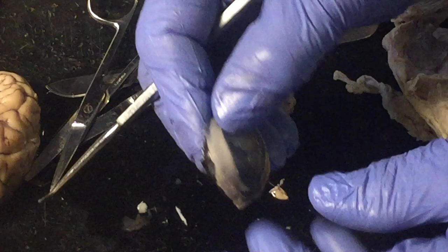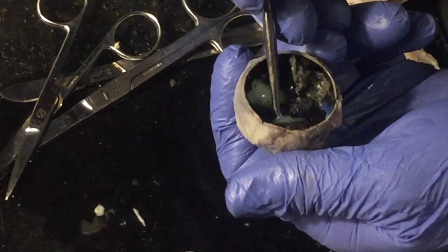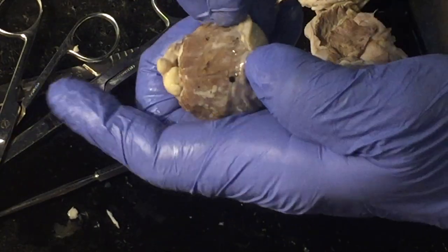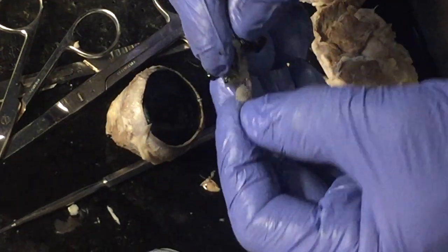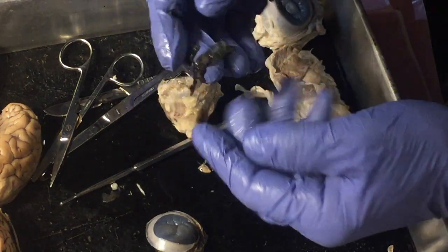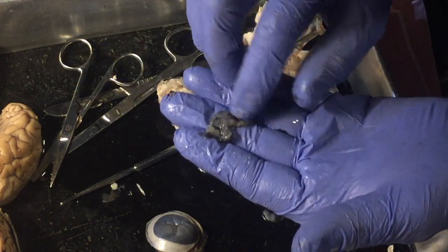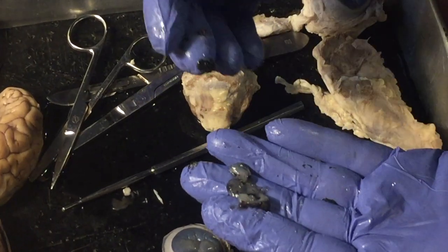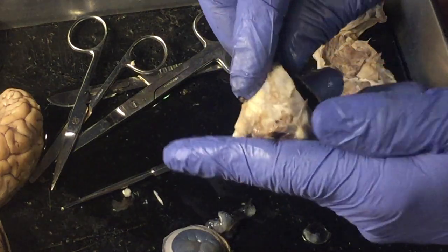If we take that front part away and look at the back part, there's a back chamber, and this back chamber is filled with a thick viscous fluid. I'll put some in my hand right here, called vitreous humor. There's something else in there too, a piece of the back of the lens. Again, this is obscured by the preservative. It should be a clear, jelly-like substance. You can see that it's kind of jelly-like, but that is called vitreous humor. The amount of it in the back of the eye would also help dictate the shape of the eye.